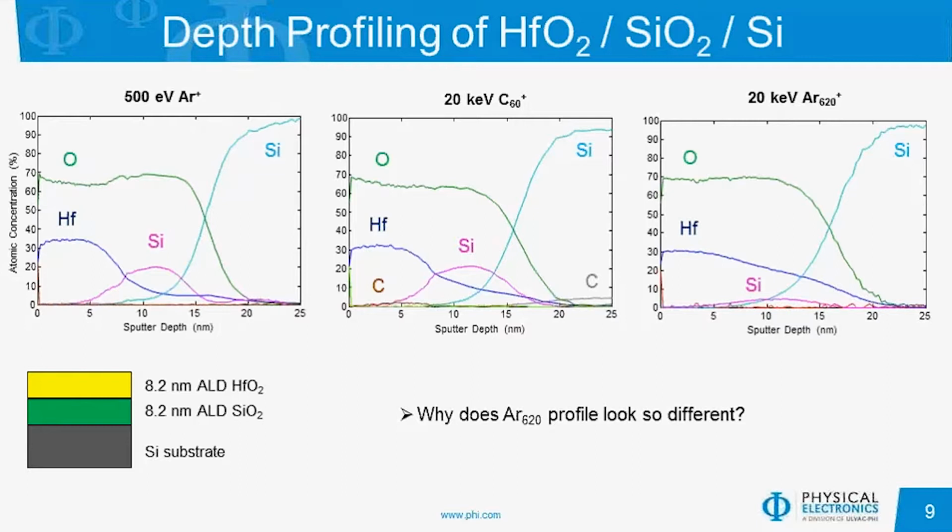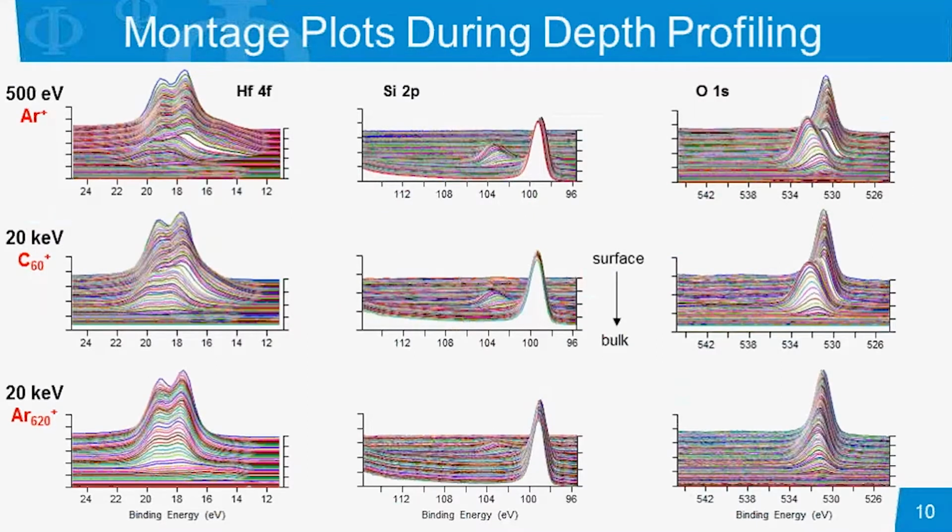Let's take a look at what may be happening with this GCIB setting on the right. What I'm showing here are montage plots through the sputter profile. So this is the spectra collected at each sputter step along the way. Going across the rows, these three figures are all part of the 500 eV monoatomic argon profile: the hafnium 4f spectra, the silicon 2p, the oxygen 1s, and in each of these, the first spectra, the surface spectra, is at the top. And as we profile through the material, we reach the bottom.